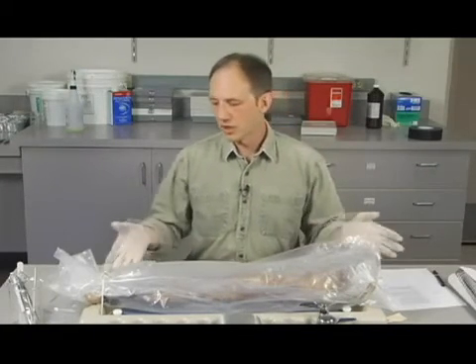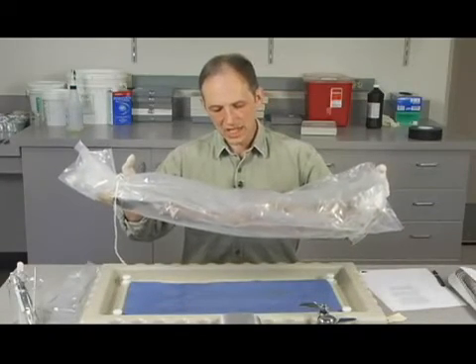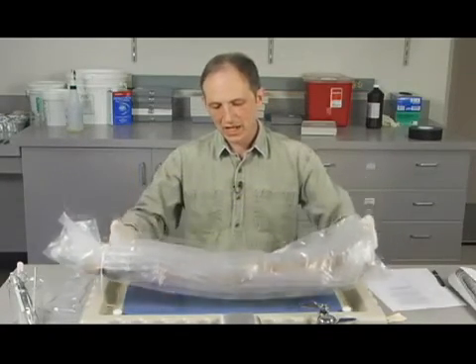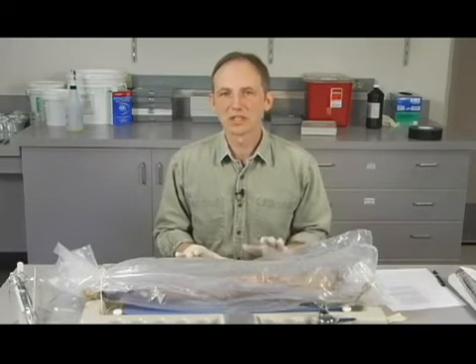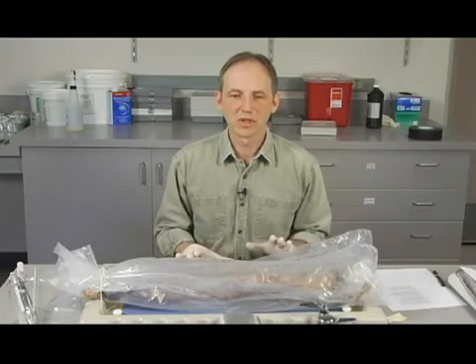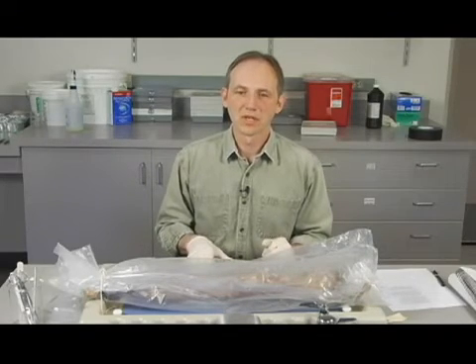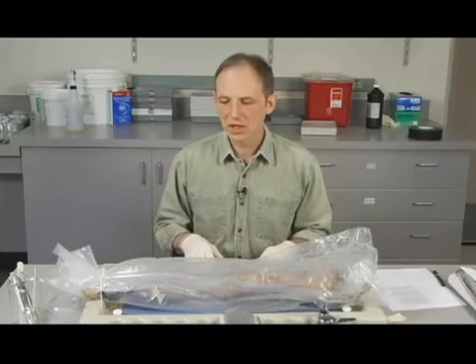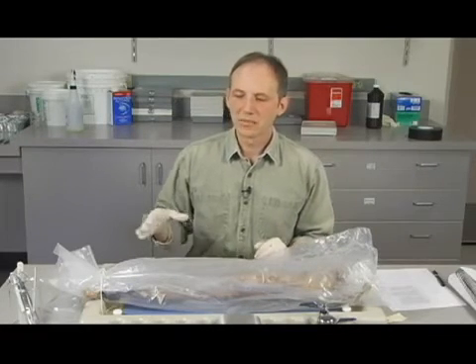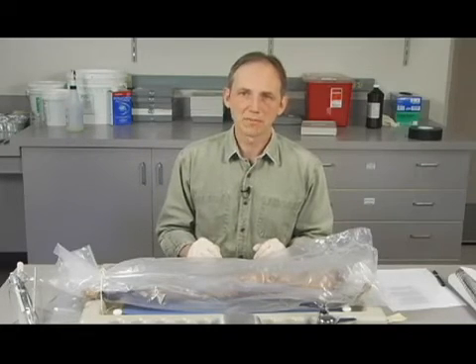The last thing, though, and I don't know if you can see this, but when you lift up the cat, there's a little bit of fluid on this tray. You also need to wash your tray, okay? And you're really responsible for that. Somebody within your group is going to have to make sure that your area gets cleaned up. So you're going to need to take this tray to the sink, just sitting behind me here, wash it out, get some paper towel and cleanser, and also clean off your tabletop.